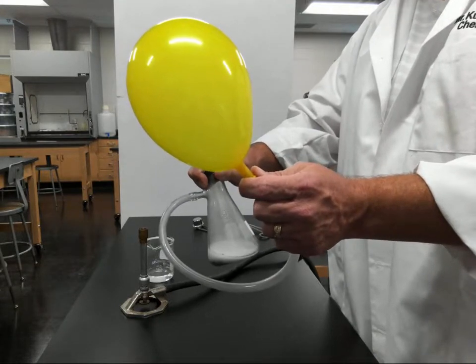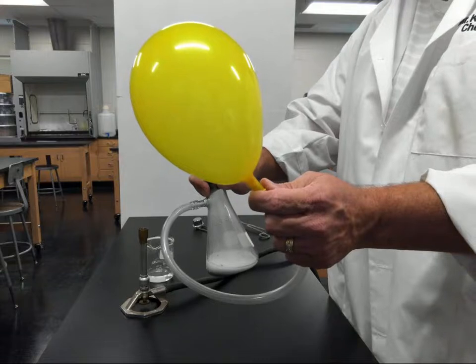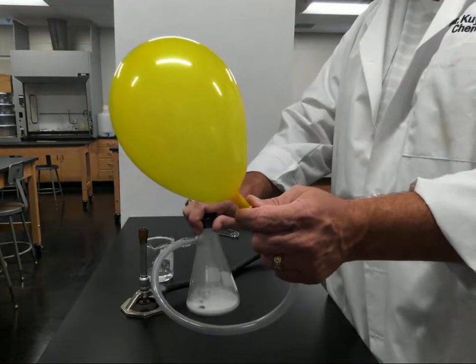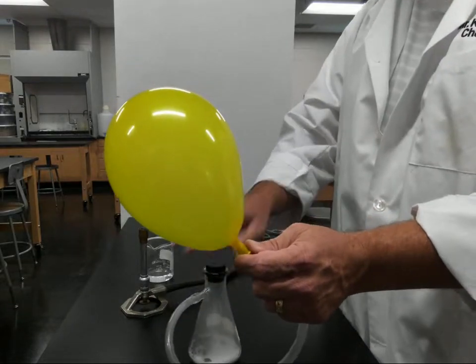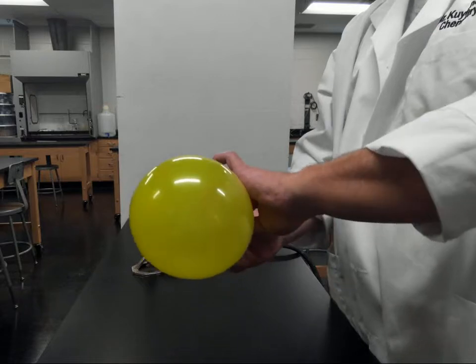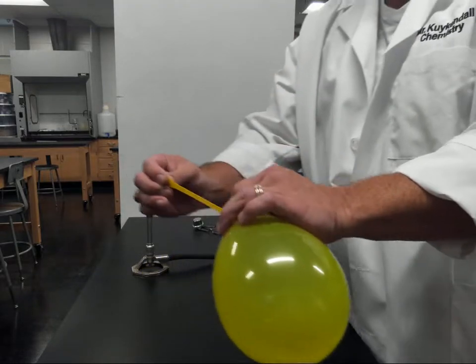Now that I actually have a nice little hydrogen balloon, I am going to take this balloon off and actually stop this reaction before continuing. I'm simply going to tie off this hydrogen balloon.